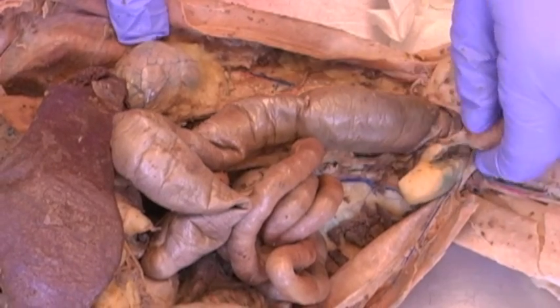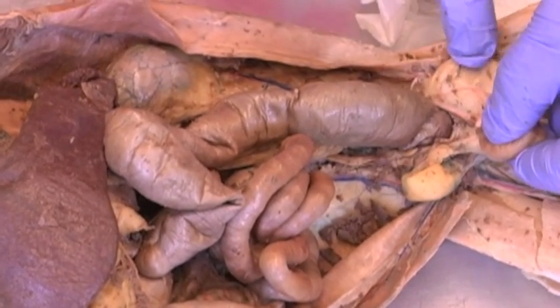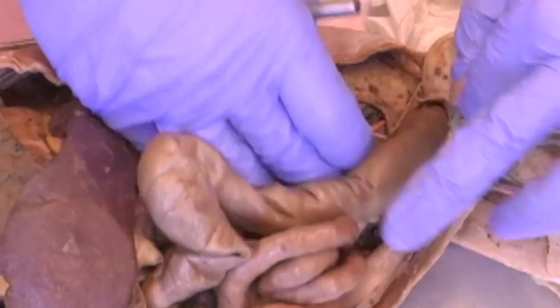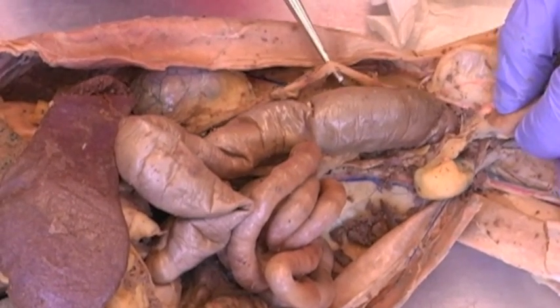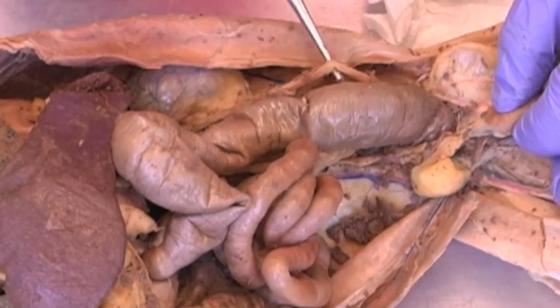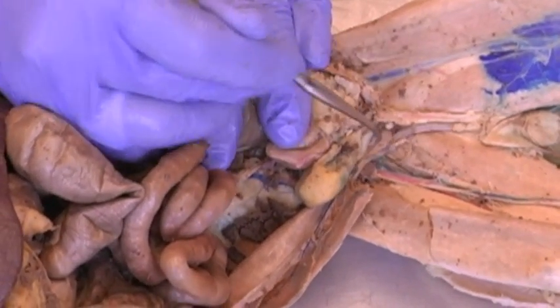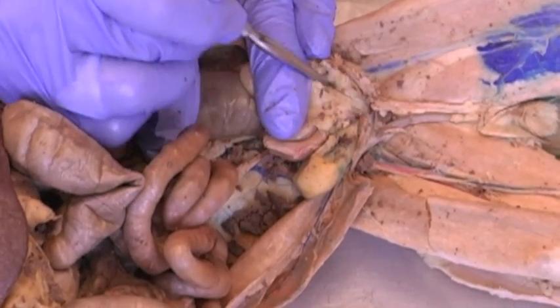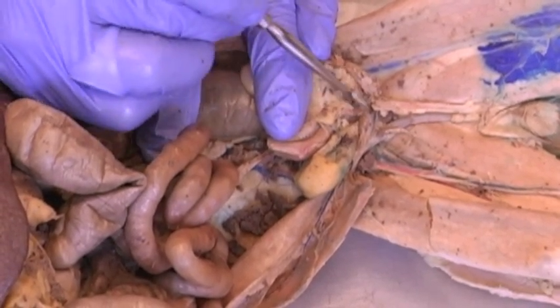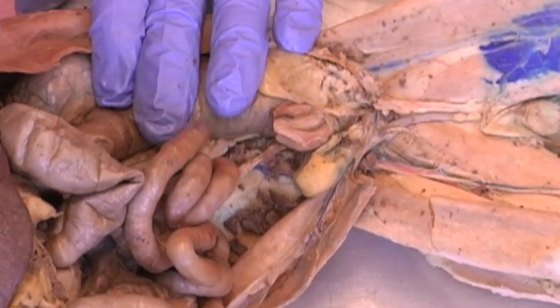So a lot of times if we pull the urinary bladder, here we see the urinary bladder and pads of fat on both sides. If we pull that, we can kind of see the ureter, which connects the kidney to the urinary bladder, bringing urine down, and then extending posteriorly from the bladder, we have the urethra that we see somewhat right here. That probably should be dissected out a little bit better, but the urethra extends beyond the urinary bladder.